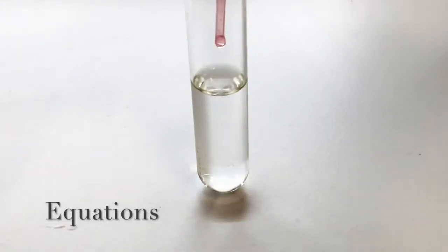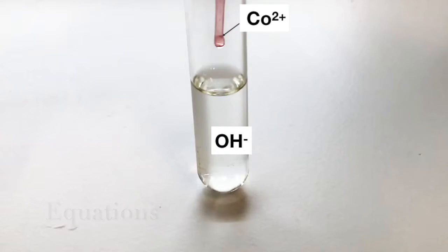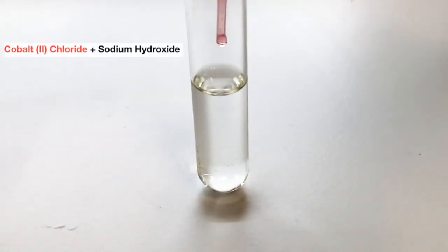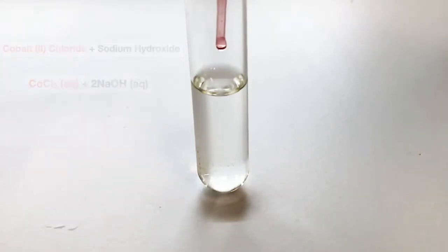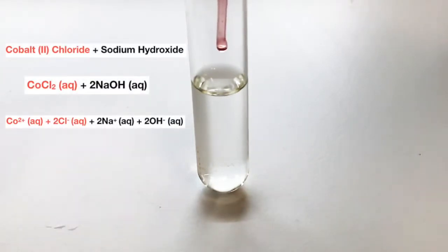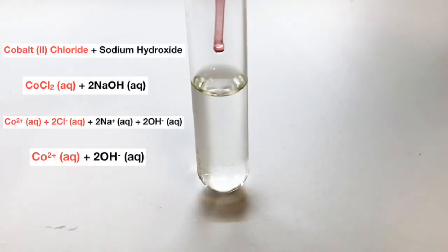Right, we have an aqueous solution of cobalt chloride, which is pink, and a clear solution of sodium hydroxide. The word equation and the balanced equation for the reactants are shown. The full ionic equation is shown here, and it shows all of the ions present in the solution, followed by the net ionic equation for the reactants here.